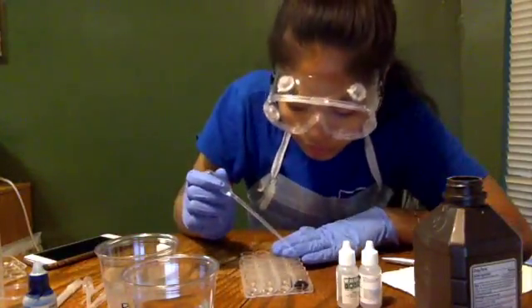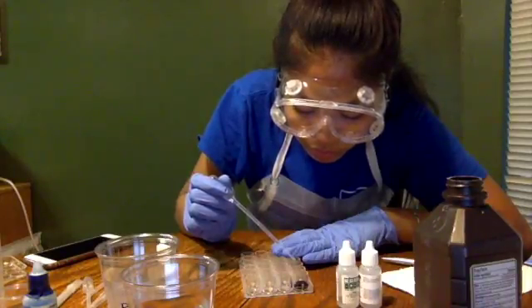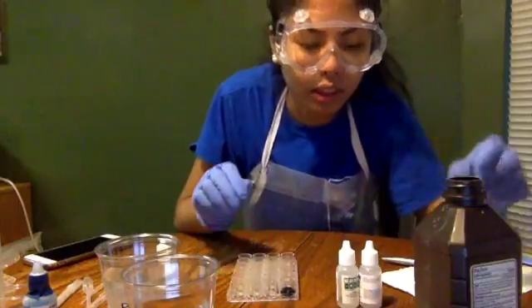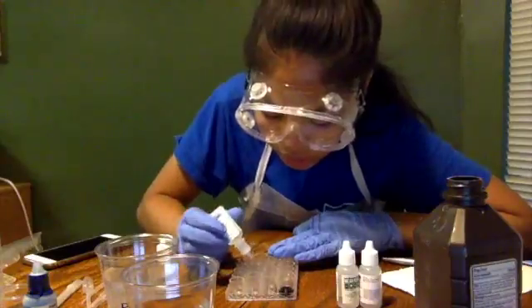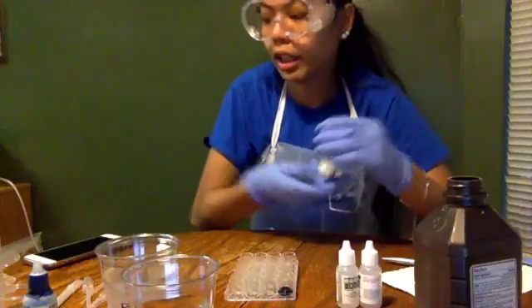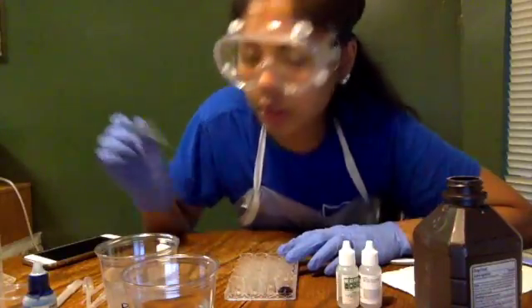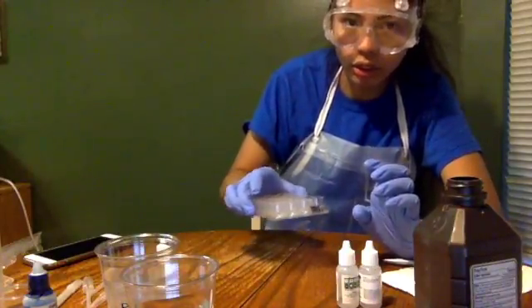So I'm going to do 1, 2, 3, 4, 5. And I'm going to swirl our solution. And for my second well, I'm going to get 10 drops of hydrochloric acid. 10. And I'm going to do 10 drops of pure water. So 5 and 10, to make a 50% HCl solution.